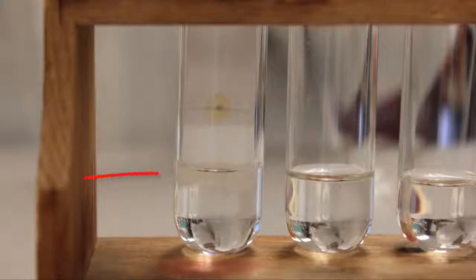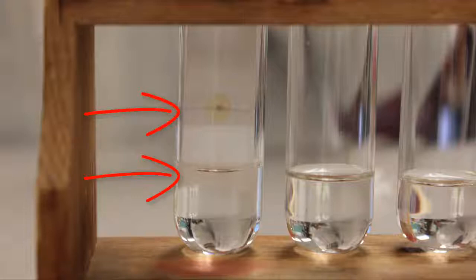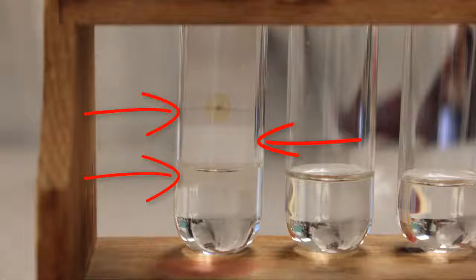Here you can see the acetone just touching the bottom of the filter paper strip, but not hitting the pencil line with the pigment, which is higher up. And here you can already see the acetone starting to wick up the paper towards the pigment.